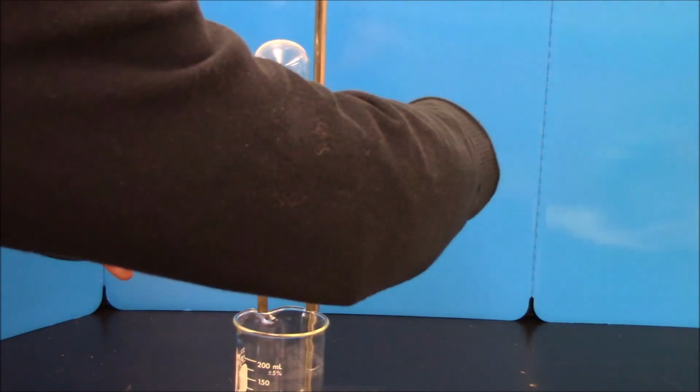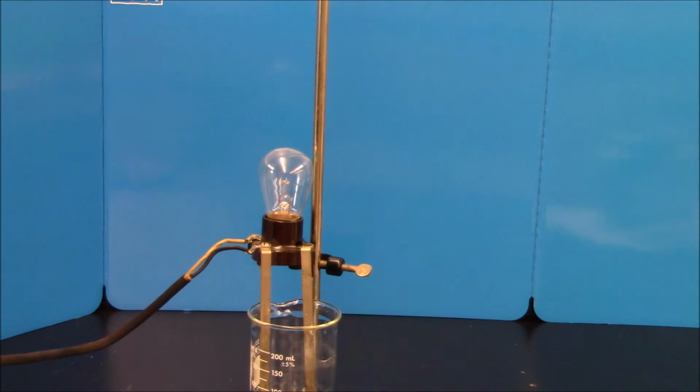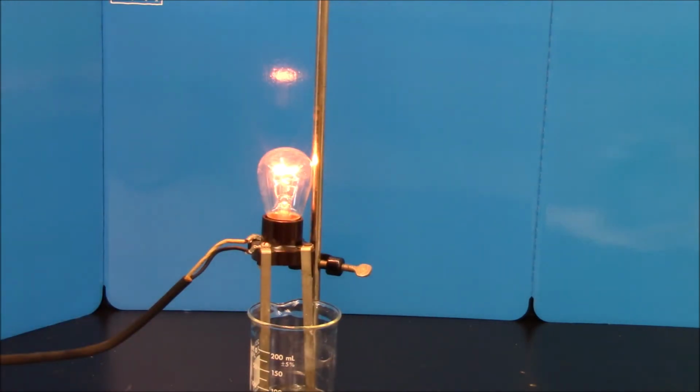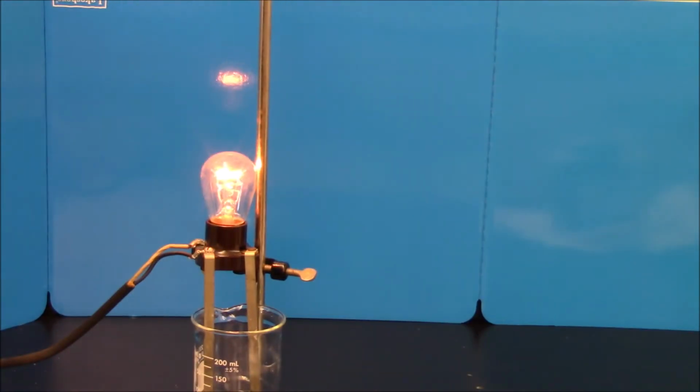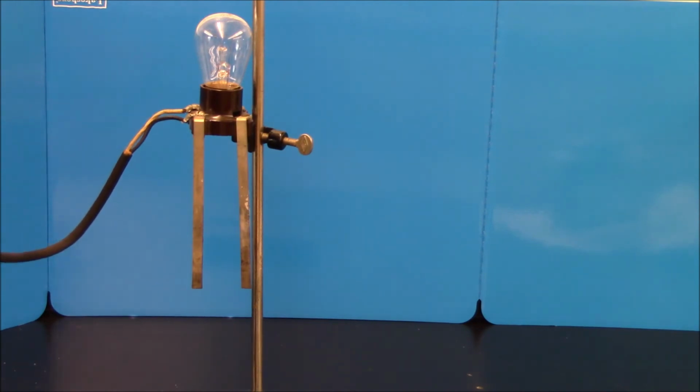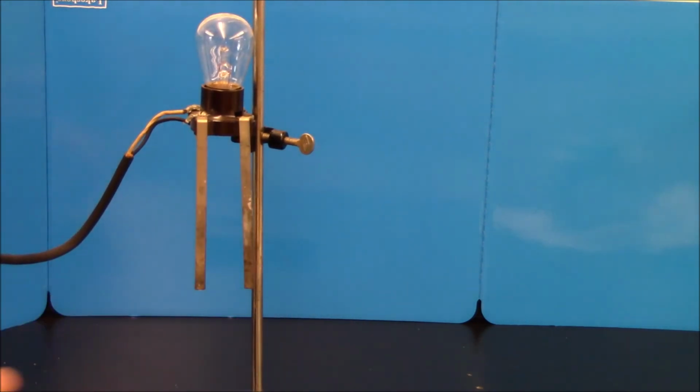Okay? Weak bases are hydroxides from parts of the table other than 1 and 2, like aluminum hydroxide, iron hydroxide, or the other one, ammonia. Ammonia is a common weak base. Let's pour some ammonia in. And again, I've got a small number of ions, so ammonia is a weak electrolyte. So for acids and bases, strong acids and strong bases are both strong electrolytes. Weak acids and weak bases are both weak electrolytes.